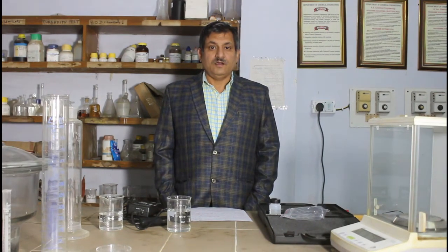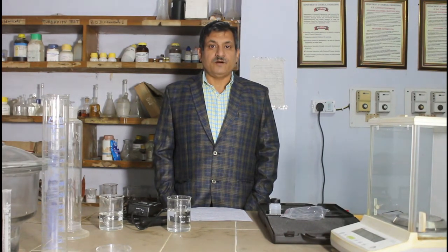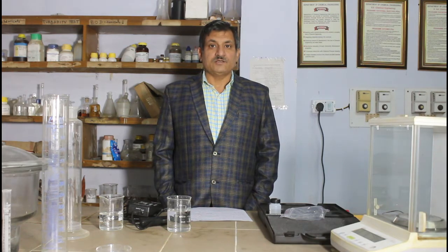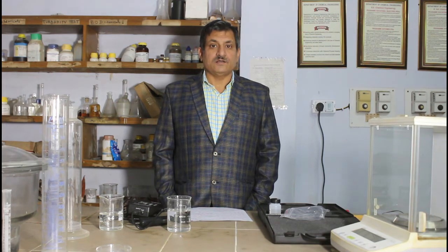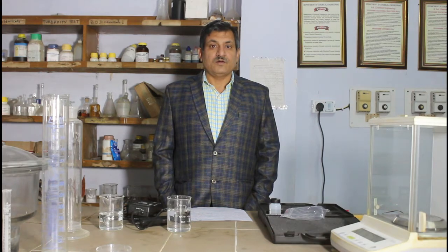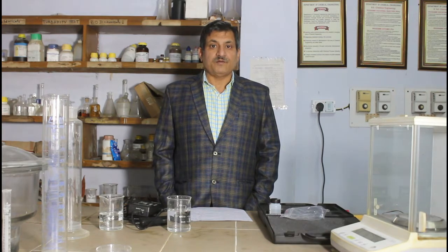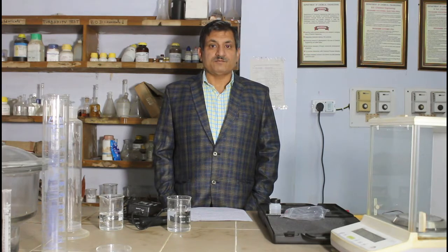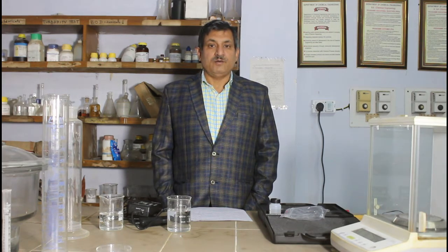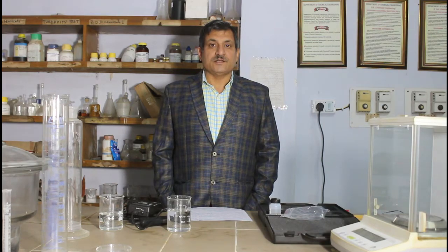Hello dear students, today we will perform the experiment of how to check dissolved oxygen in any sample of water or effluent sample. Before performing this experiment in our laboratory, I will introduce you about what is dissolved oxygen.